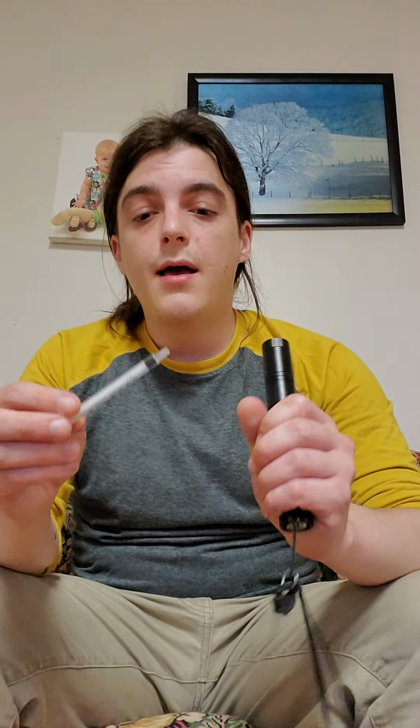Without much more ado, the next thing you need is just a syringe. And I know people go, oh no, a syringe. This isn't a hypodermic needle, it's just a syringe. So a lot of people when they hear syringe, they think needles and stuff like that. You find these a lot if you have children's acetaminophen or ibuprofen.